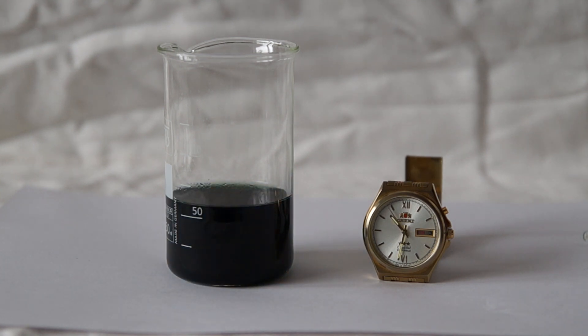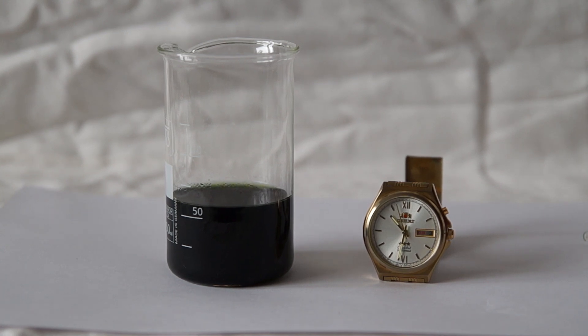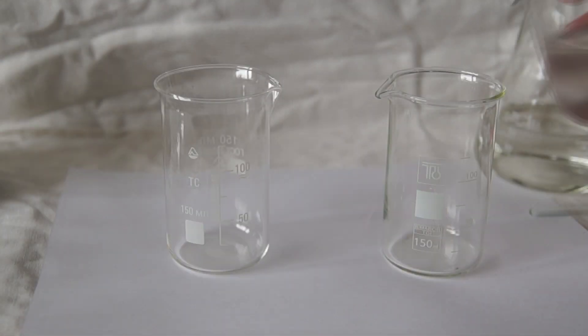The color change is the reaction between iodine and starch. Starch as an indicator of iodine. Now take two beakers of the first working solution.